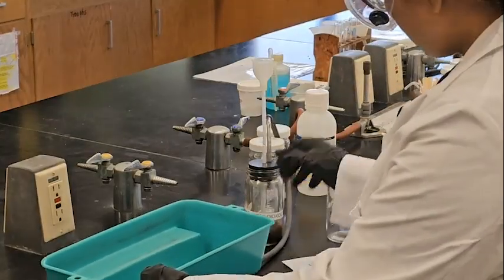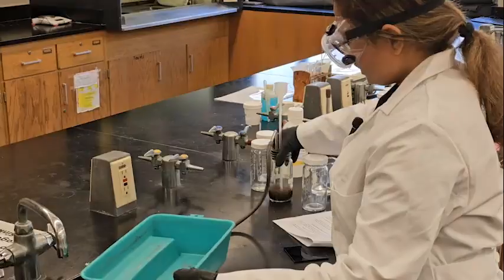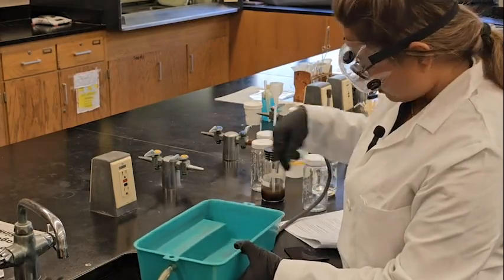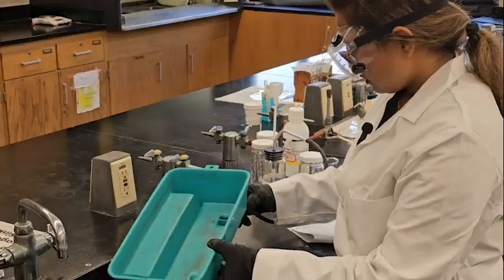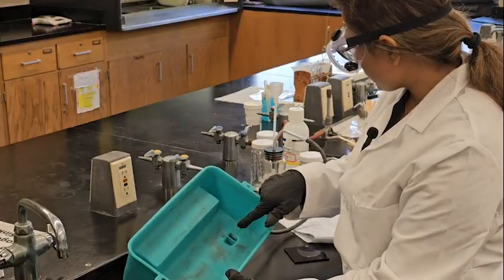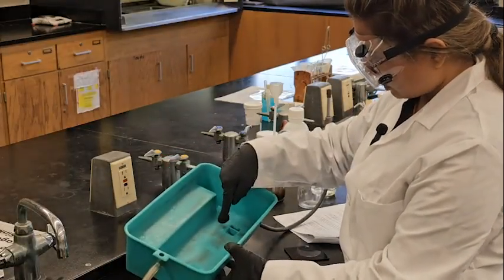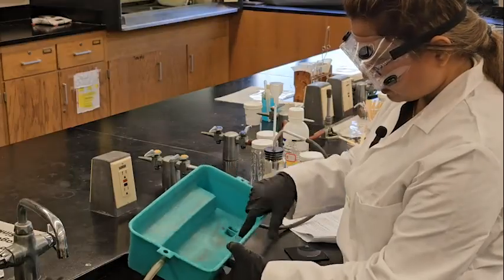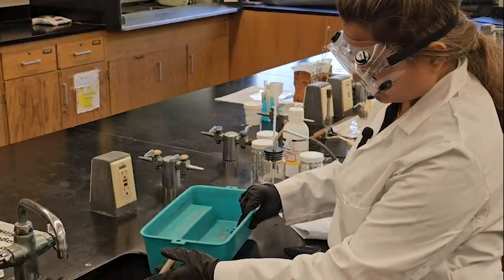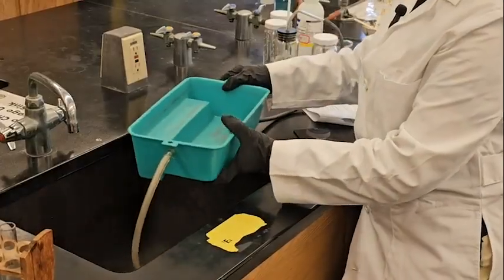First thing is to collect this tray. I'm collecting oxygen gas from here, right? There is one hole in here from where I'm going to collect the oxygen gas. You see the pipe is connected to this. So I'm collecting oxygen gas from this hole. This pipe should be pointing downward to the sink. Otherwise, your station will be wet.